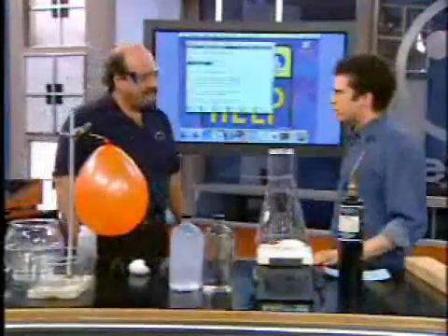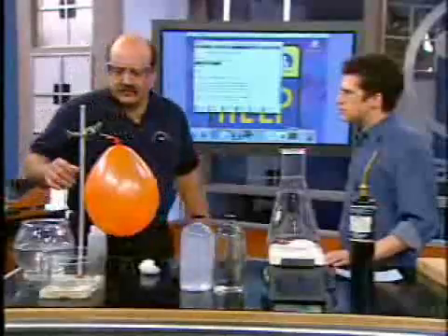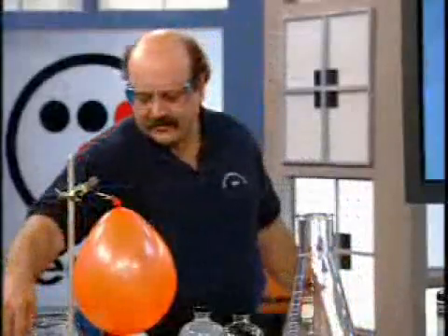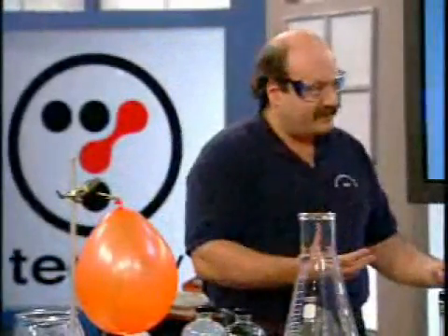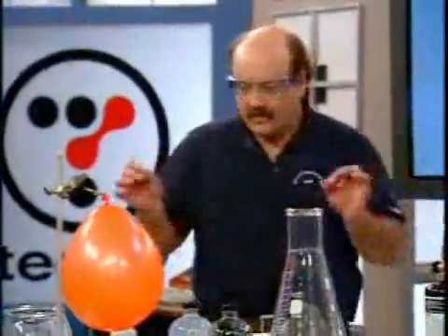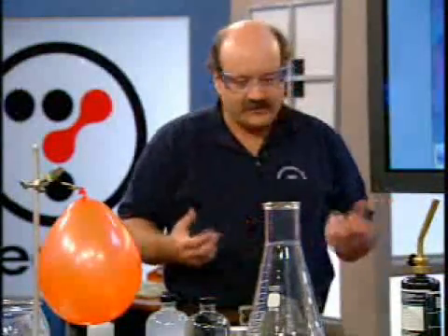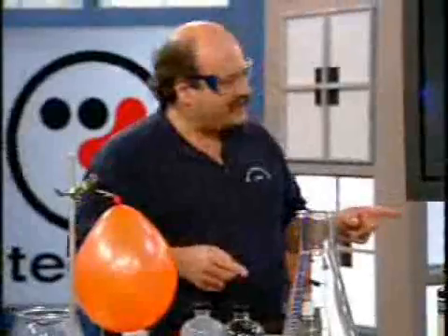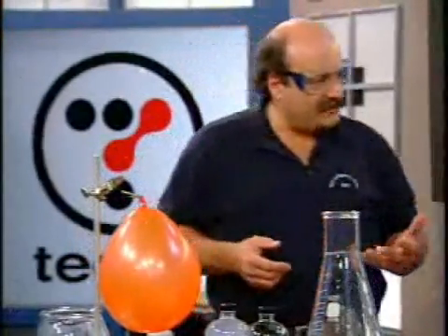What kind of basics are we going to be covering today? Well, today I wanted to go over one of the very basic principles of chemistry, and that is that chemical reactions have rates. And what I want to show you is how we can improve and increase the rates of reactions in chemistry. And I'm going to use oxidation as my vehicle, my reaction vehicle.